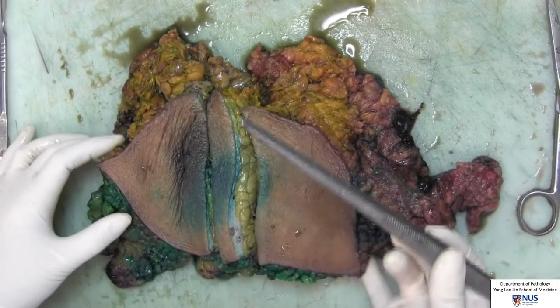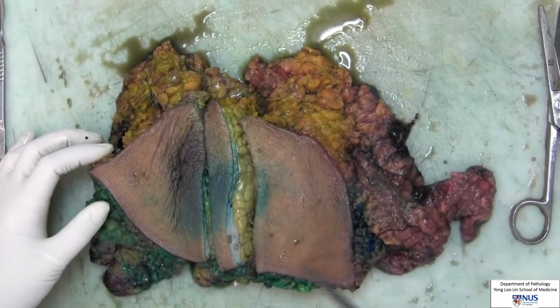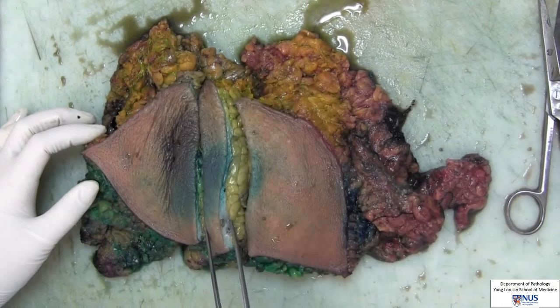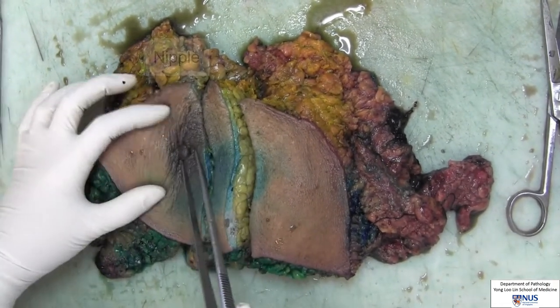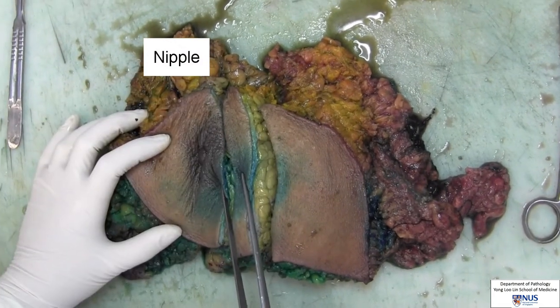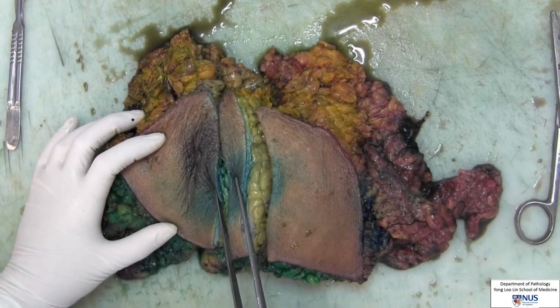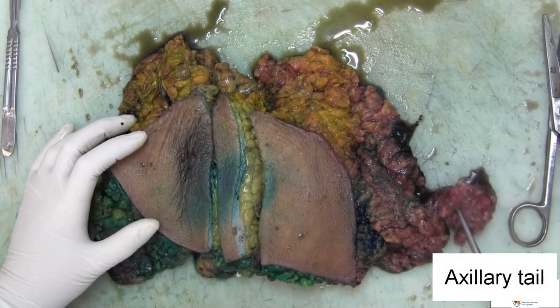This is a right mastectomy specimen showing the ellipse of skin, a sliced portion of the breast, and the nipple region. The dye was previously injected to identify the sentinel lymph node. To orientate, this is the axillary tail.